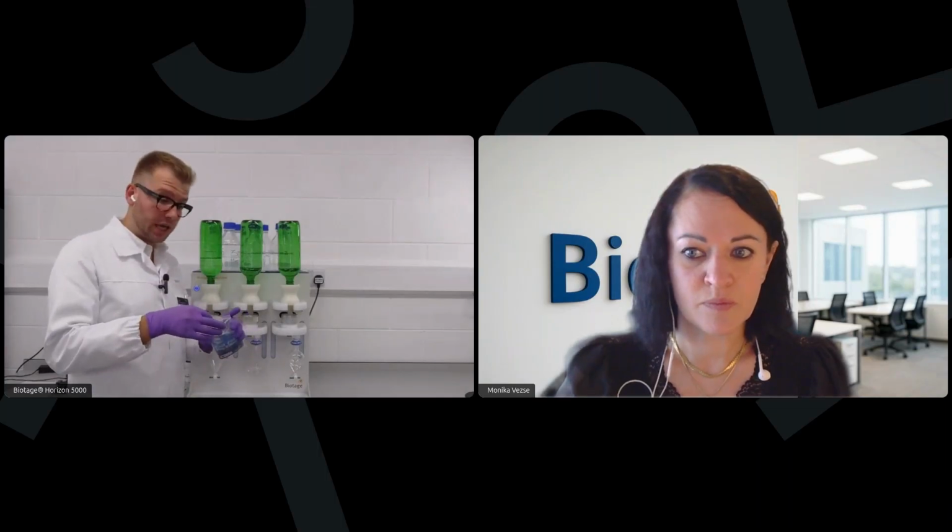Yes, so we have pre-filters. In this case, these are the same size. We also have a fast flow disc holder, which essentially has a much larger surface area at the top, with the SPE disc much smaller at the bottom, which looks just like this. And again, the key to proper processing of these type of samples with heavy large suspended solids amounts is really the proper layering on top of the disc to not clog the disc.